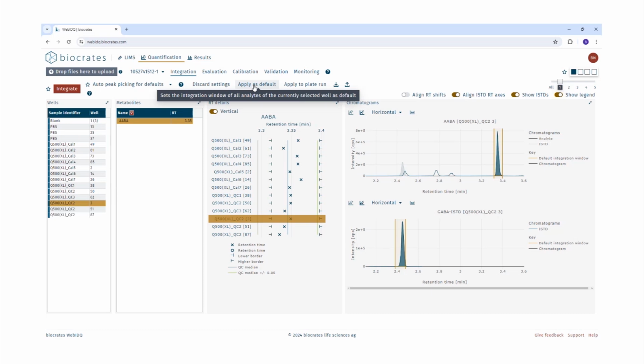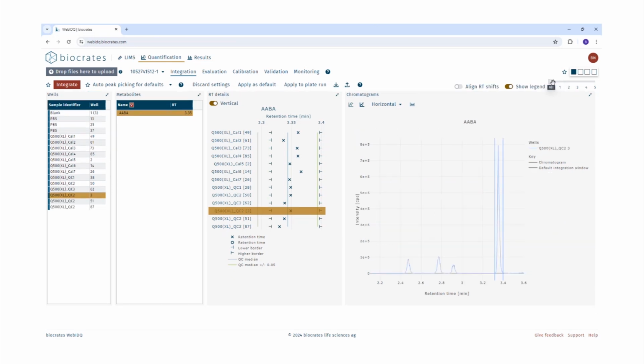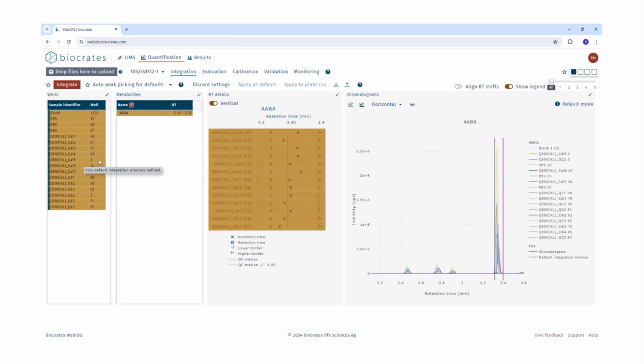So we all know that retention times must be reproducible and stable within one plate run, and chromatograms are overlaying on top of one another. In WebIDQ, it is possible to overlay all the chromatograms on top of one another just by setting this slider from 1 to all and selecting here all the samples just by pressing Ctrl A. Here we can see that now all the chromatograms are overlaying on top of one another.